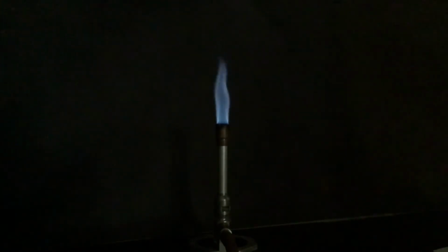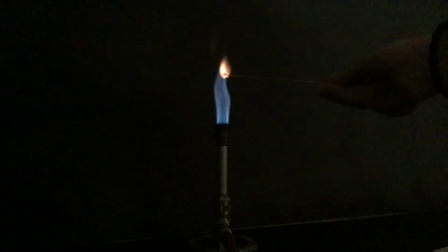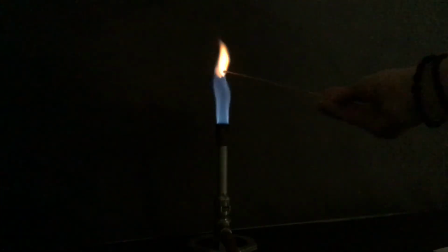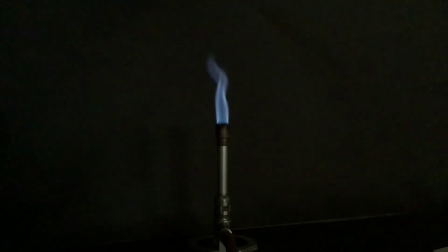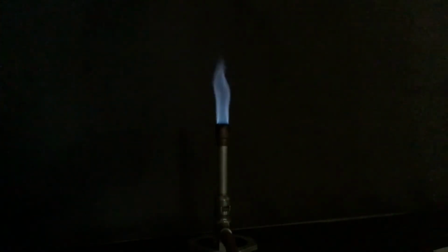And the last of our initial chemicals to test is going to be potassium. I'm going to go get a different thing of potassium to test really quickly. Let's try this. It looked like that potassium had some contaminants in it, which can be a pretty big issue with flame tests.